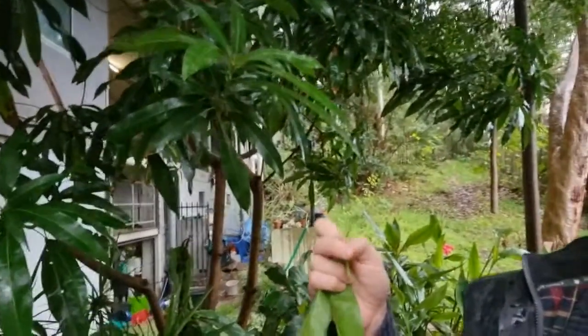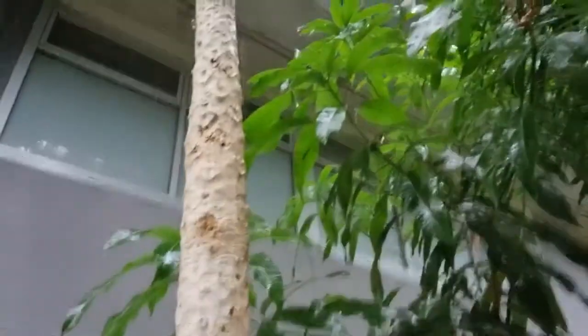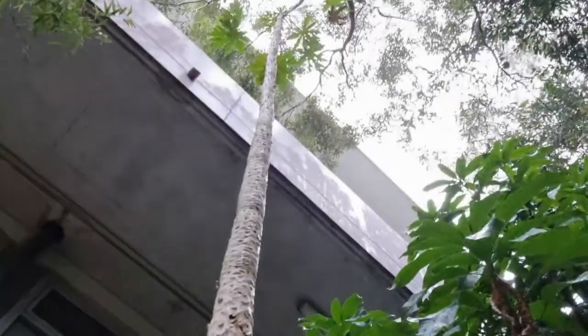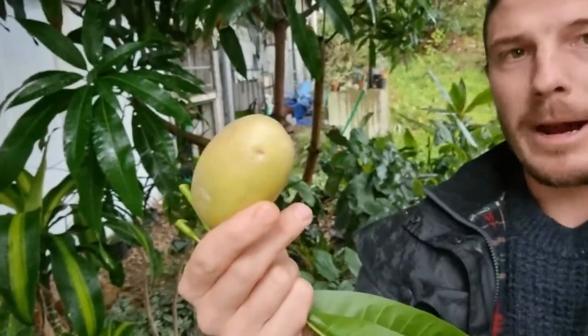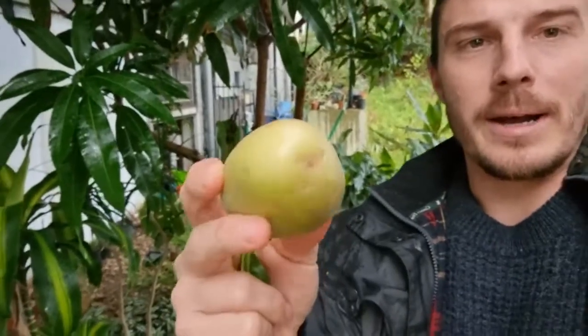Unfortunately, as you can see, it's the middle of winter, so this mango isn't going to have any fruit on it, nor is this pawpaw tree, which you can see up there. That's pawpaw. It doesn't have any fruit on it, so instead I've got an apple here, which is going to be our fruit from the tree, and I've also got a potato, so we can imagine that that's part of the root of the tree, and we're going to test each one of these things for glucose and for starch.